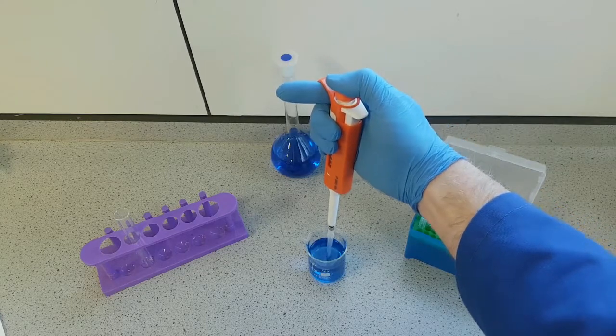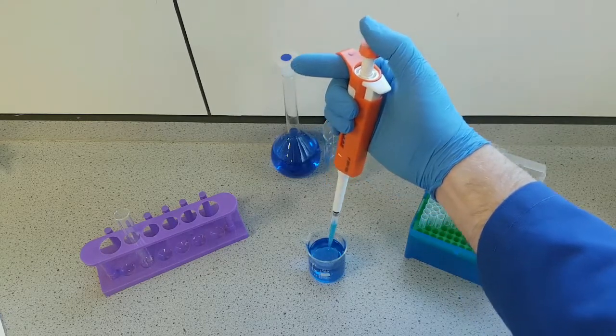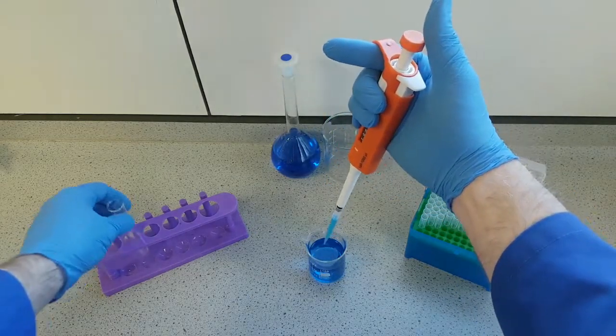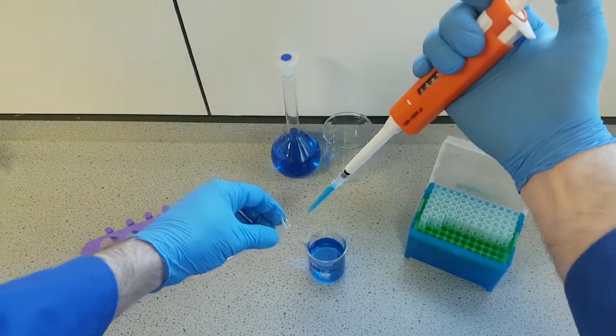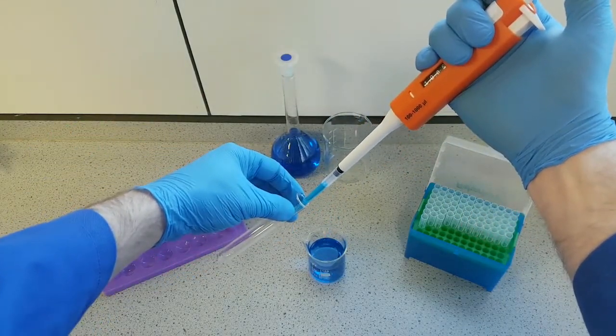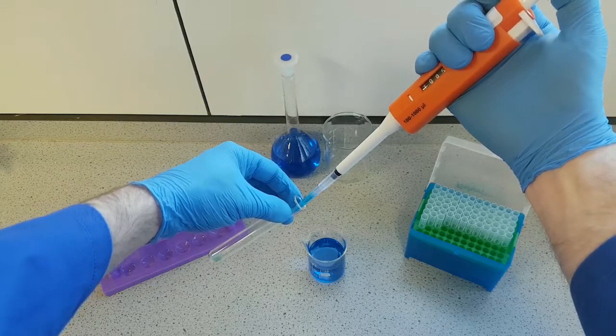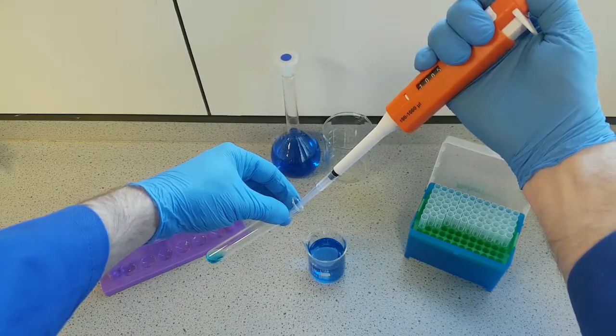Then we're ready to draw up our sample to put into a test tube, for example. I tend to dispense my sample at 30 degrees and allow the solution to run down the side of the test tube, like that.